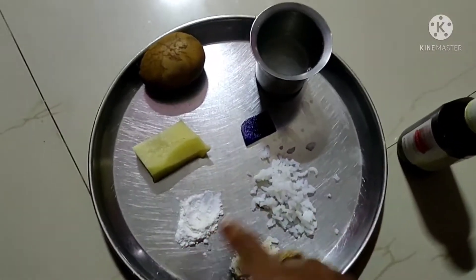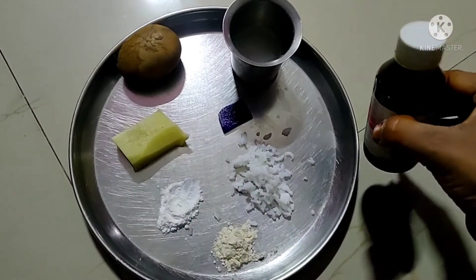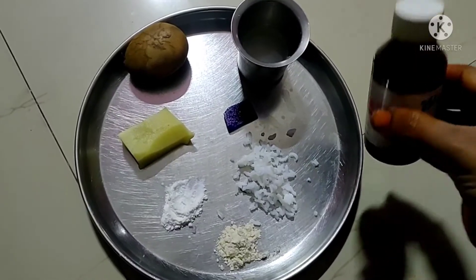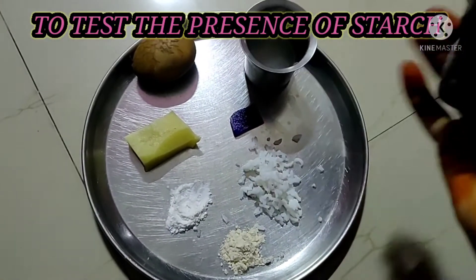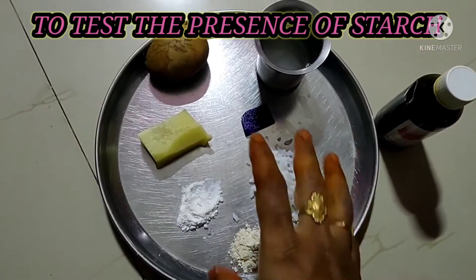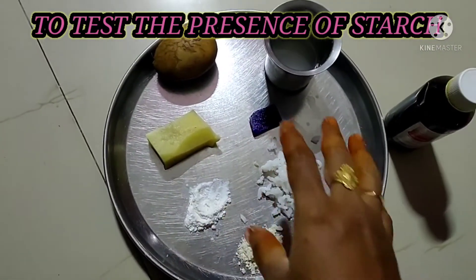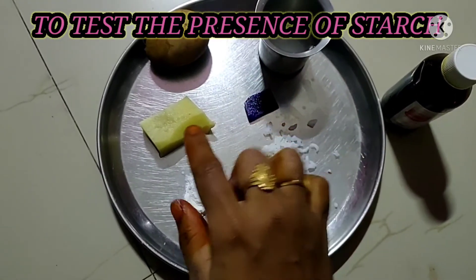Good morning children, welcome to Lakshmi Study Room. Today we are going to test the carbohydrates present in food. For this we need iodine solution, and we will test some food items to find out whether these food items have carbohydrates or not.